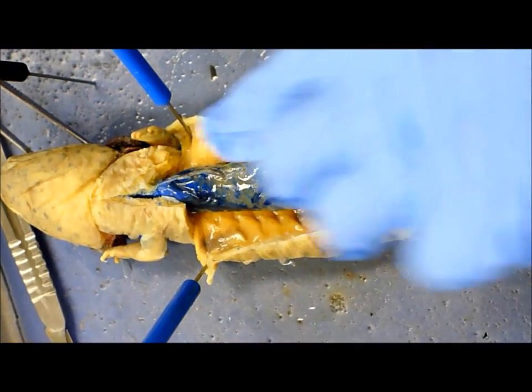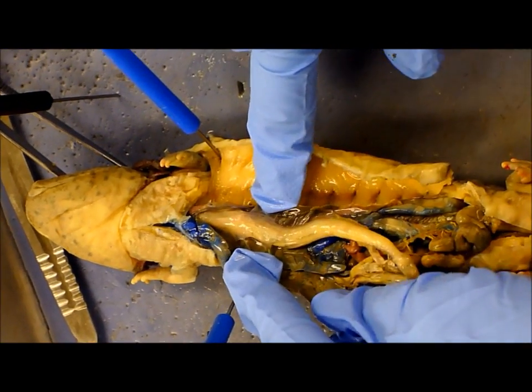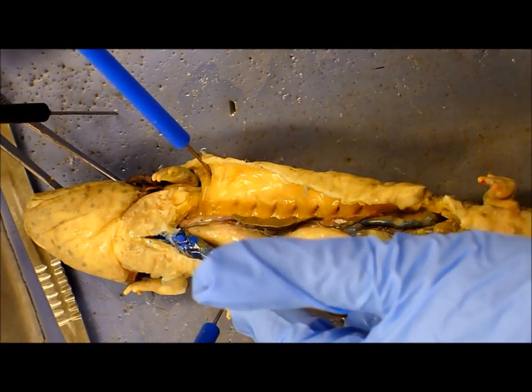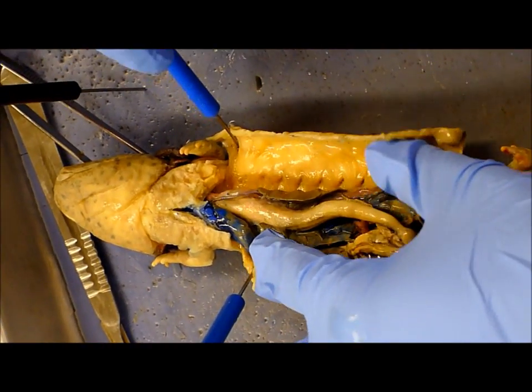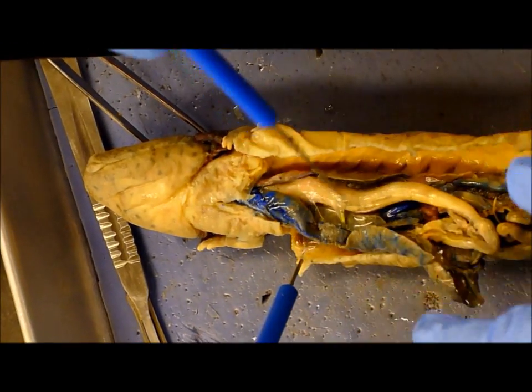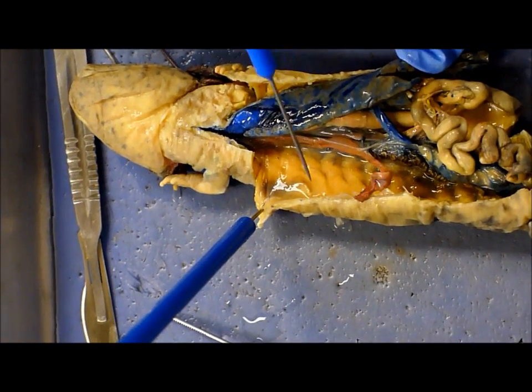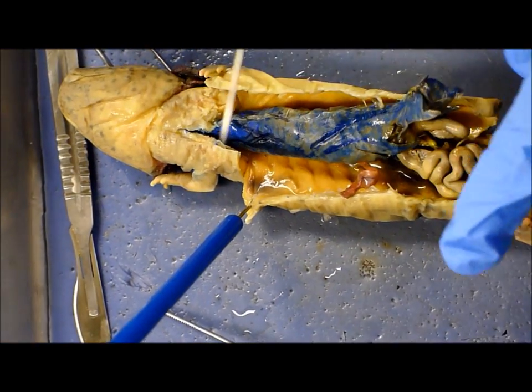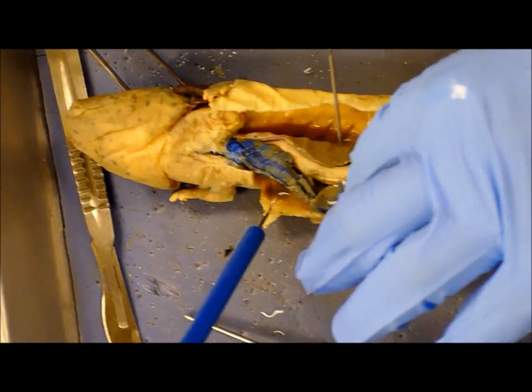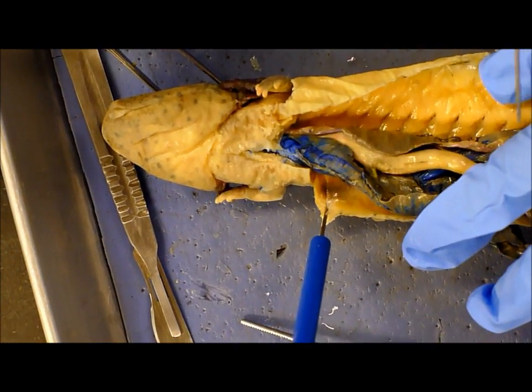And the stomach — if you fold back the liver here — is right in here. The esophagus is more up in this region. The lungs are very narrow, right here — little air-filled sacs — and then the one on the other side is right here. The spleen is this gray thing attached to the stomach.